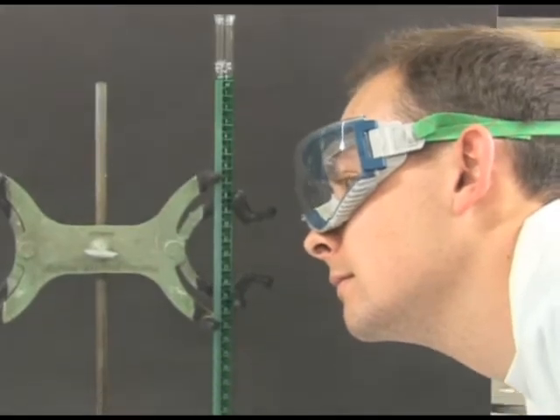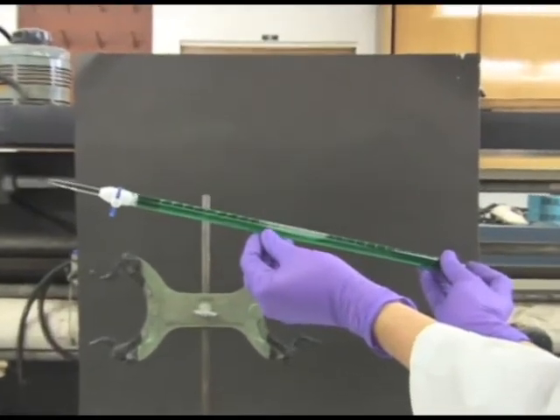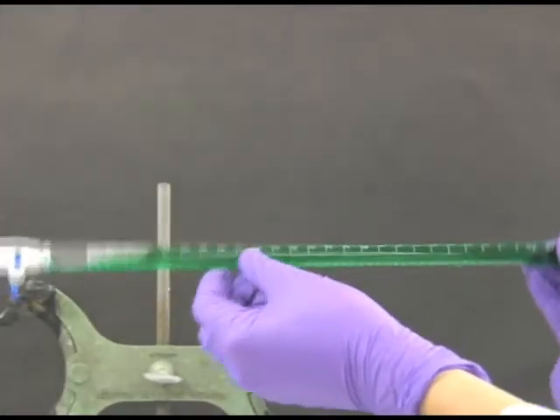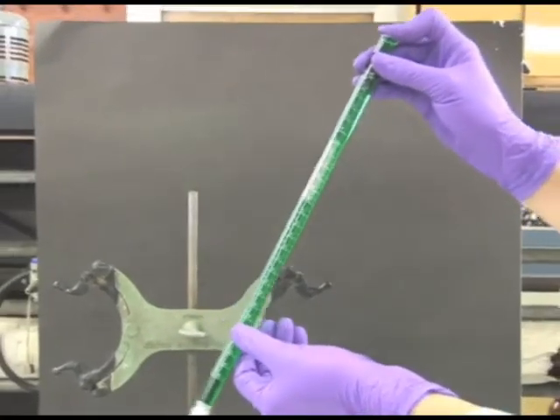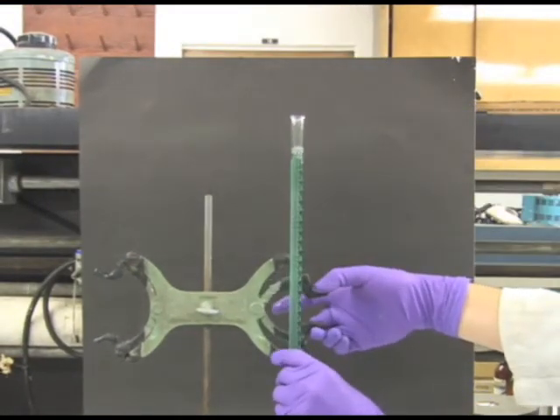Make sure there are no air bubbles in the burett. If air bubbles appear, gently tip the burett to release the air bubble and add solution as needed to make sure the solution is above the 0.00 line.